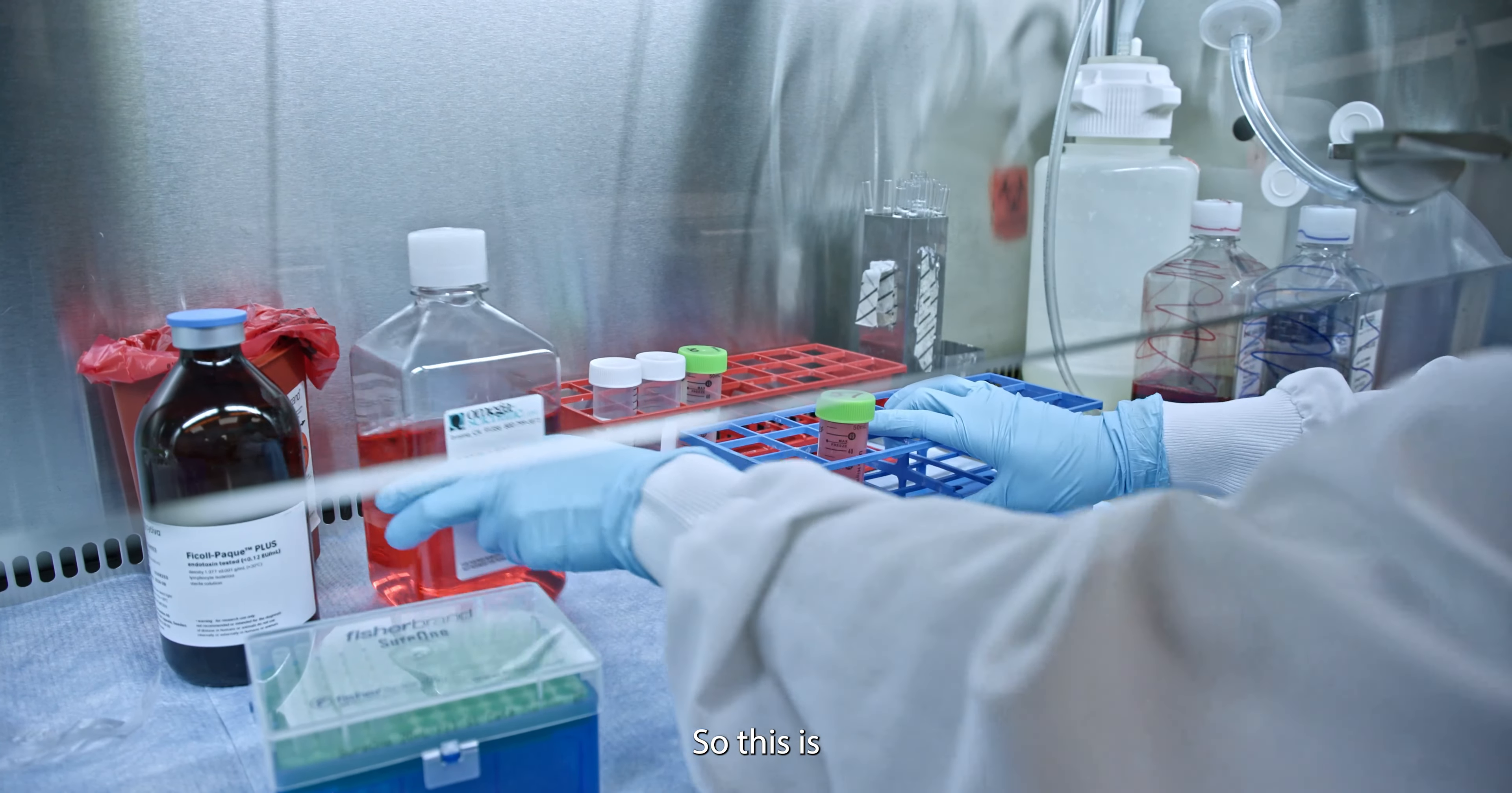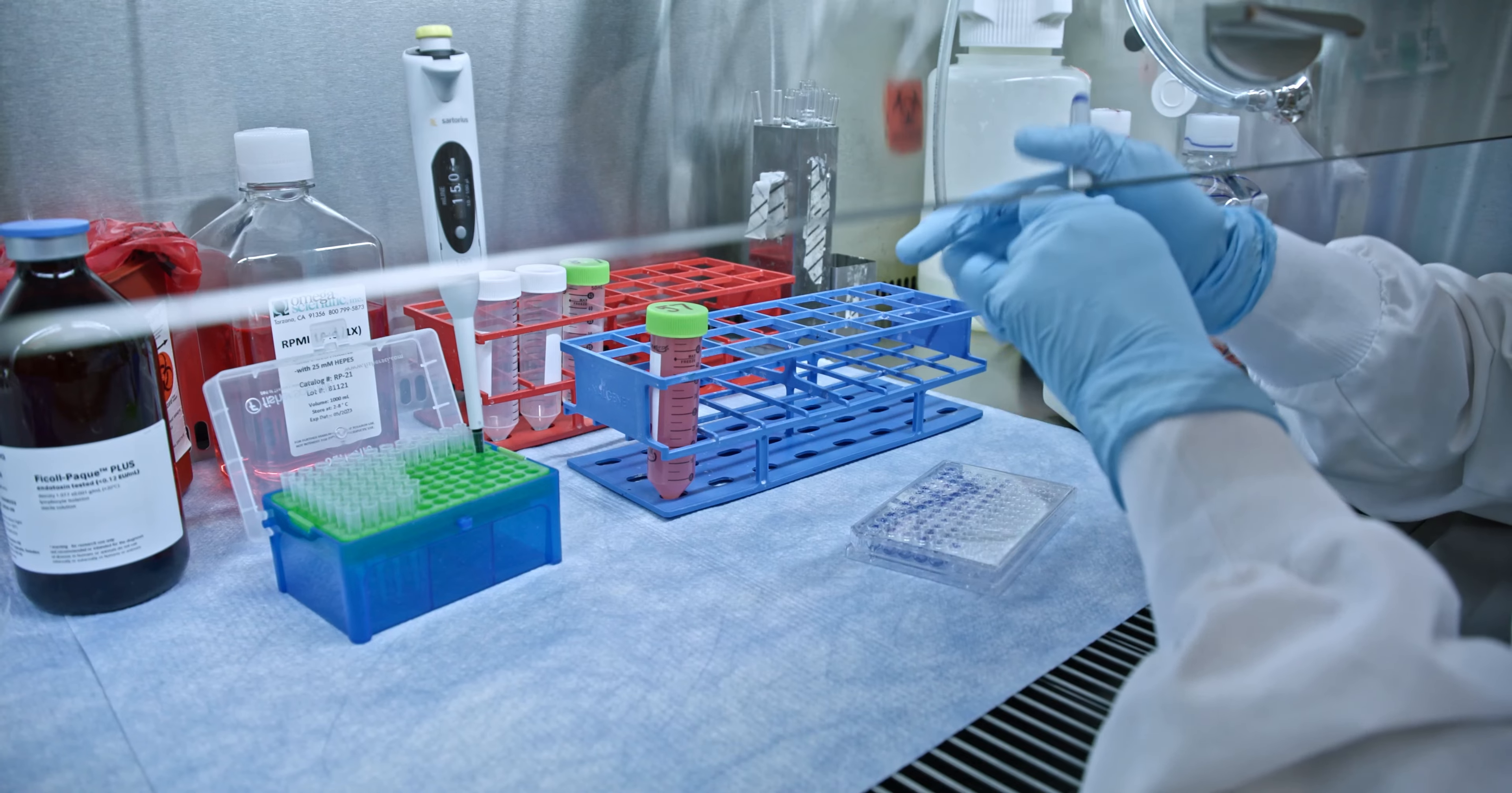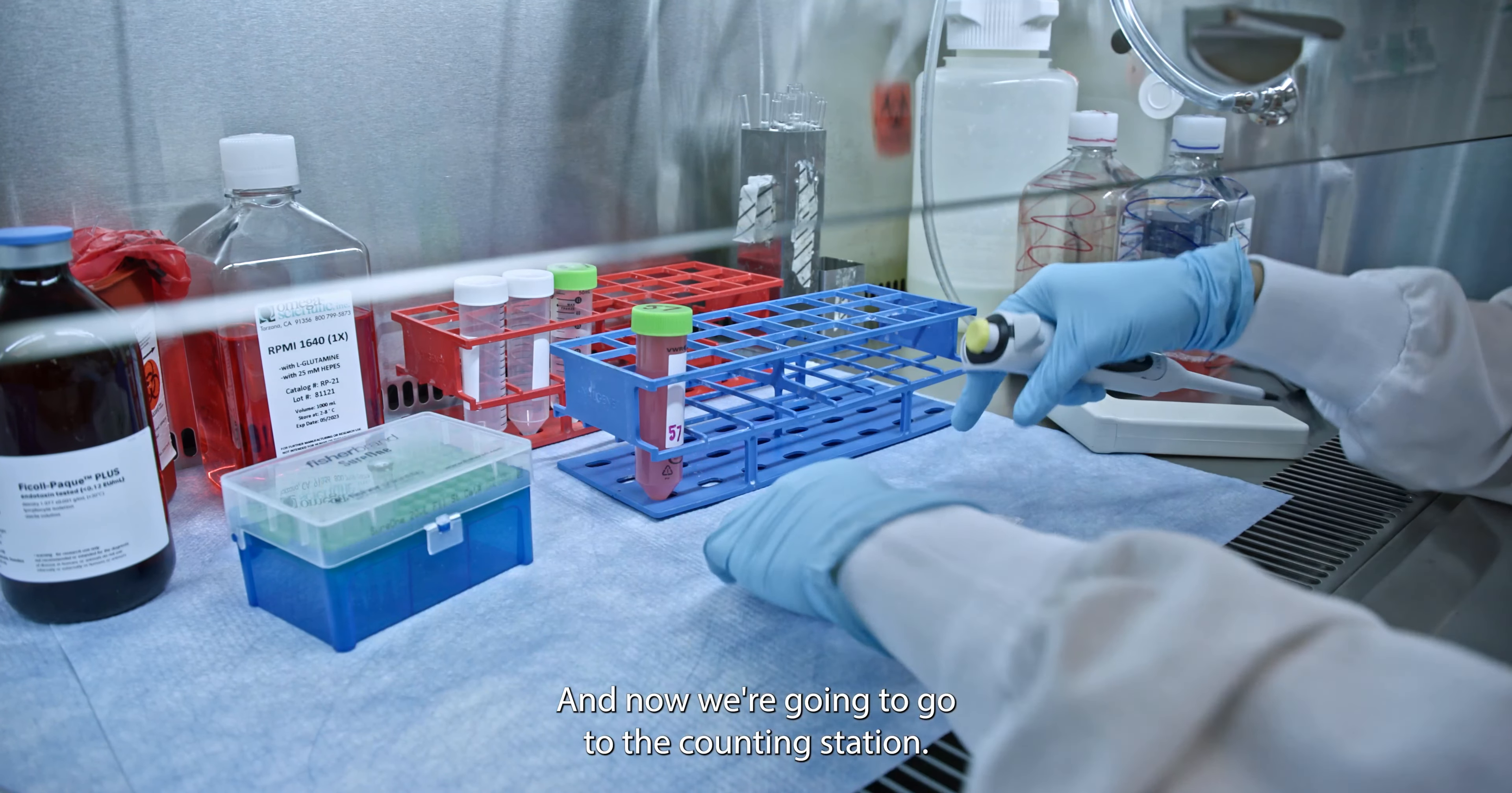So this is our final tube of PBMCs resuspended in fresh RPMI. We want to know how many cells we have now so I'm going to pull a small sample into this tray for counting. And now we're going to go to the counting station.